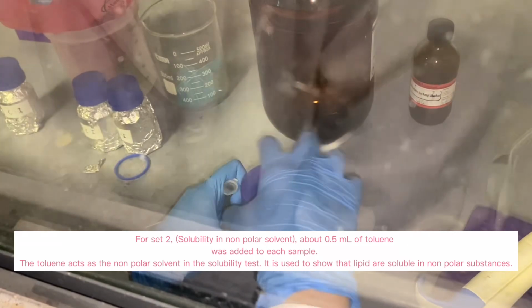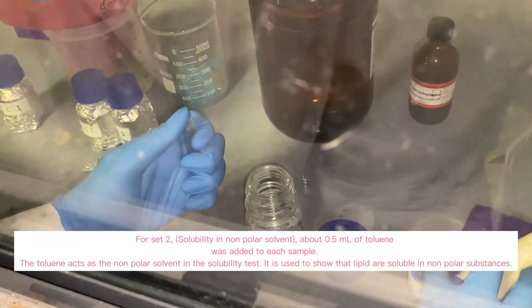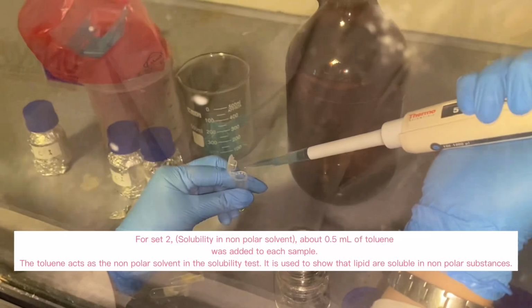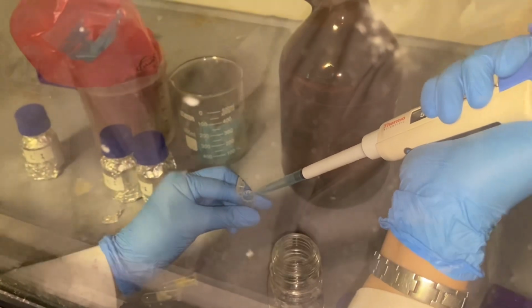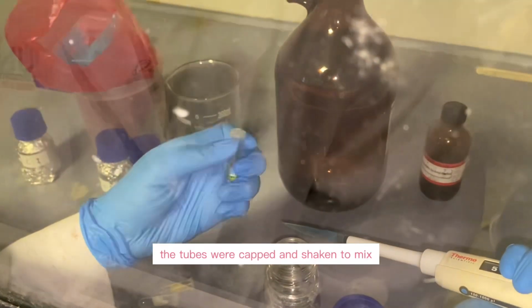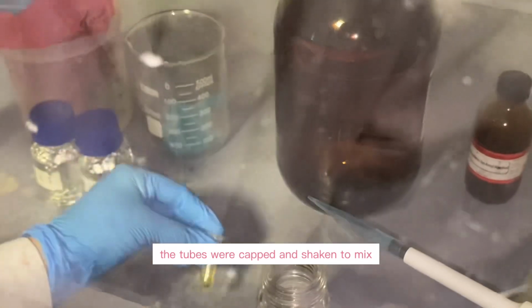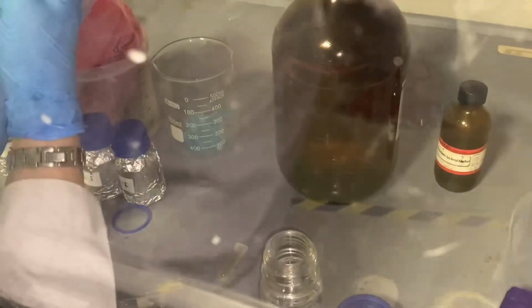Alright, for the second set, we used toluene as a non-polar solvent, and the toluene was added into each sample. The toluene here acts as the non-polar solvent in the solubility test. It is used to show that lipids are soluble in non-polar substances. The pipette tip was disposed of to avoid contamination.